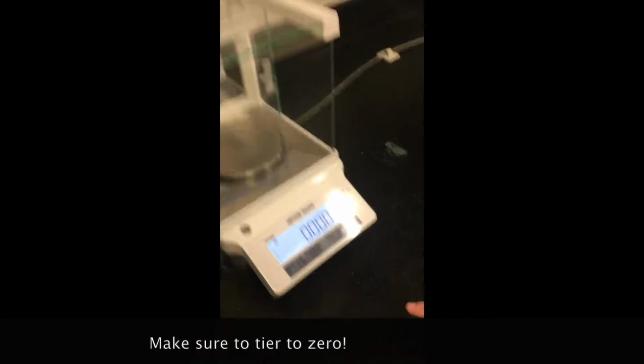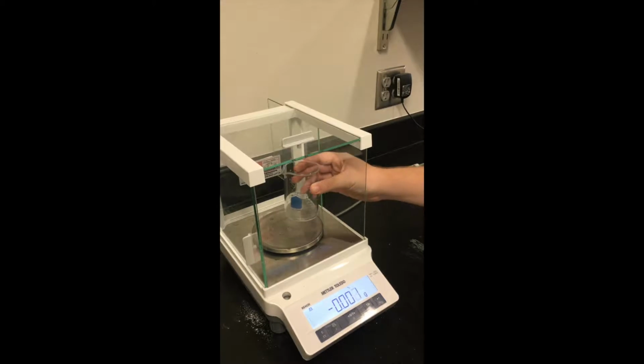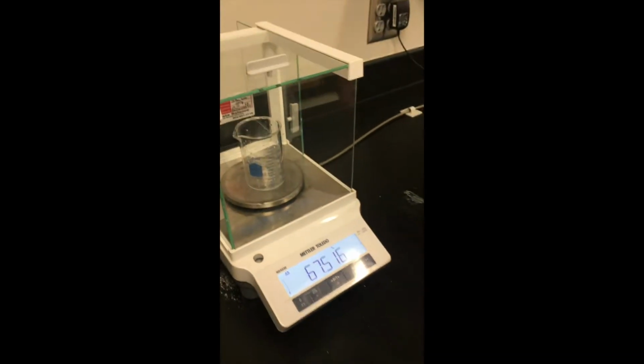Start off by taking the mass of the empty beaker. Since our lab group had 4 people in it, our lab will consist of 4 trials. Our beaker mass was 67.516.